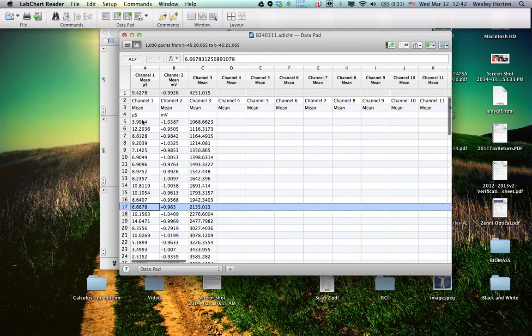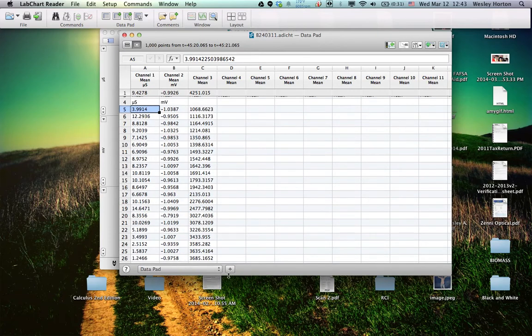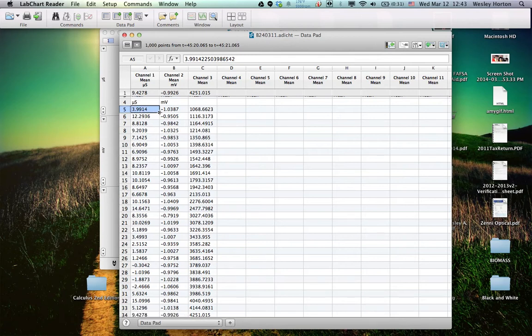And now, the first 15 data points are going to be the means of 1 second before each unpleasant stimulus. So we're going to select all those. So we need 1, 2, 3, 4, 5, 6, 7, 8, 9, 10, up to 15. Oh, sorry, whoops. Let me redo that, 1 through 15. Undo. Okay.